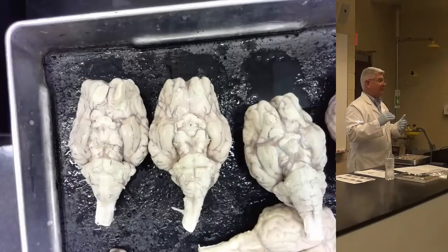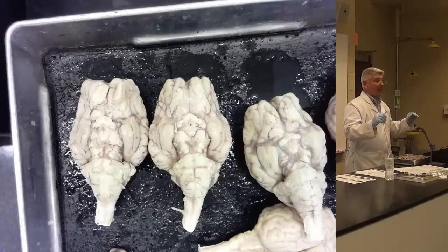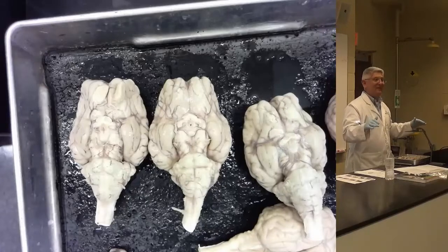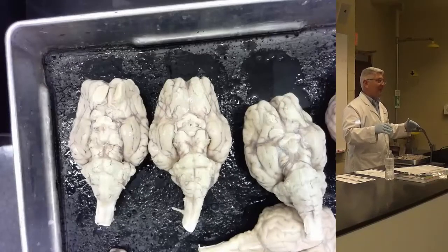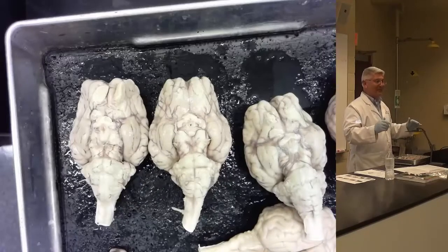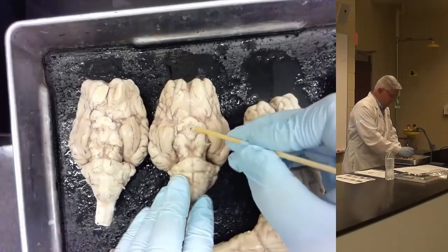But that's the connection between your brain and your endocrine system and your pituitary gland. That's why we want to learn it. I'm not asking you to learn anything in here because I'm trying to haze you or make your life miserable. Every structure we're learning in here, we're going to talk about in class, and you need to know where it is, and that's why we're learning it in here. It's not an exercise to weed people out. It's really important. There's no extraneous material that I'm asking you to learn. I promise. So the infundibulum, it's fun.